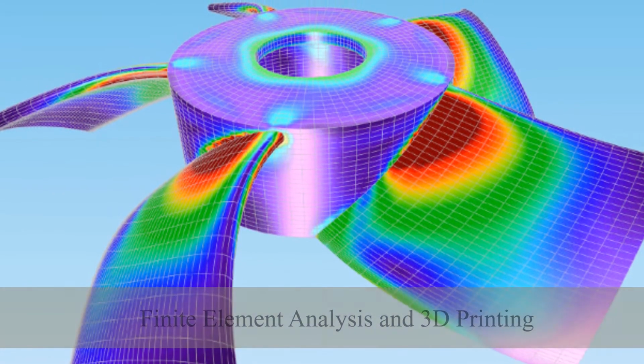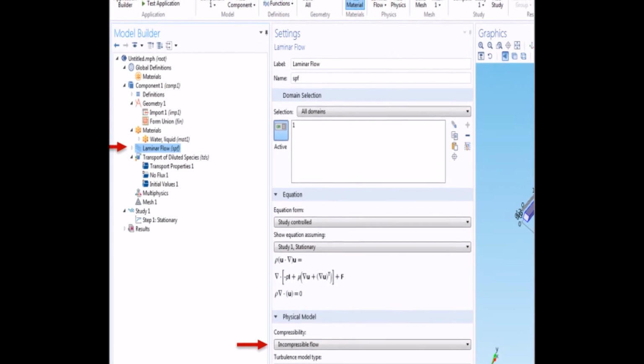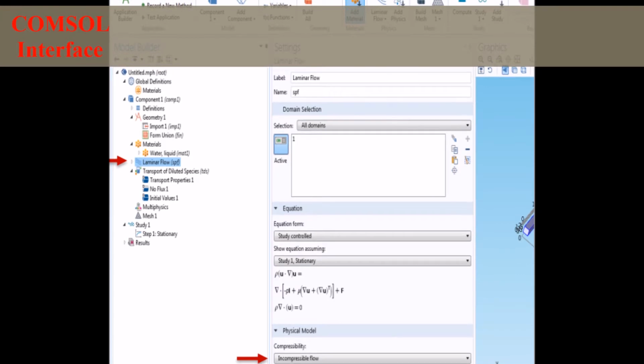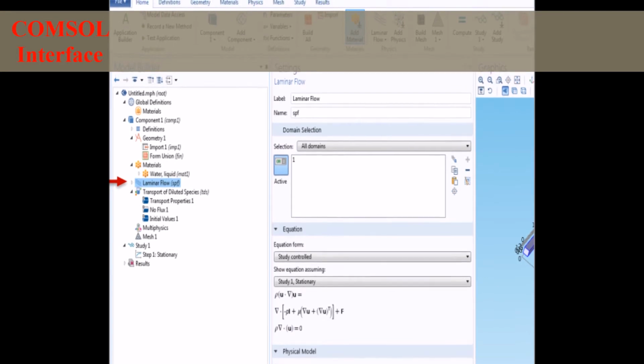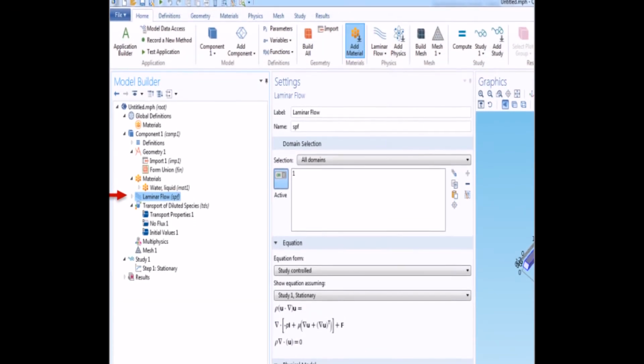Finite element analysis programs such as COMSOL alleviate the complex calculations with a computational engine built to apply transport and kinetic principles to any geometry. Instead of a revised 3D model adding to the backlog of required physical calculations, COMSOL simply requires the upload of a new STL file to handle a new geometry.